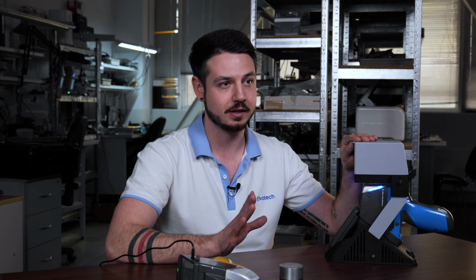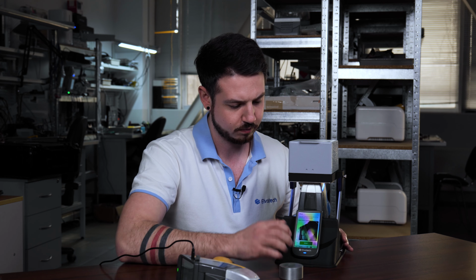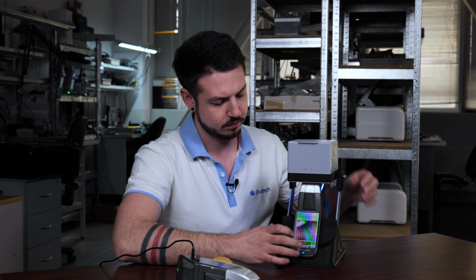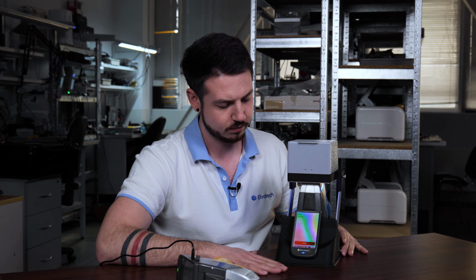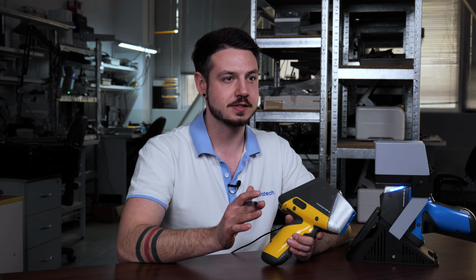This allows convenient interaction with the analyzer. The use of a lab stand with an on-screen button makes analysis more convenient, especially when working with small or precision-demanding samples. The next step is to set analysis time.